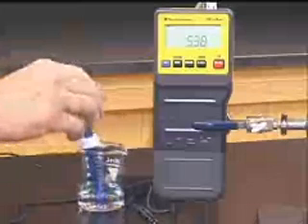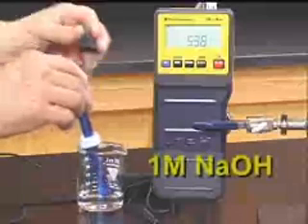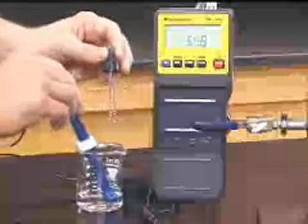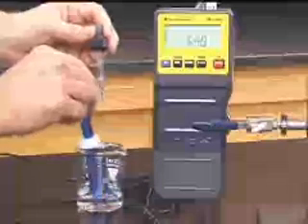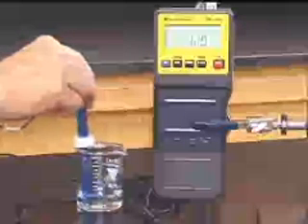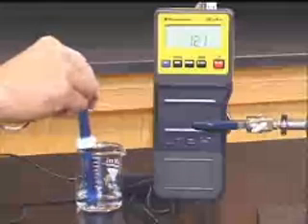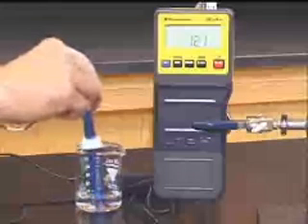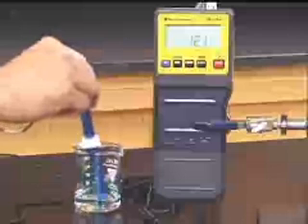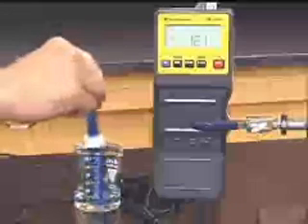What we're going to do is add a drop of one molar NaOH to the solution. Notice that the pH rises rapidly to a pH of greater than 12. Pure water, again, is not a very good buffer. If we add a strong base, the pH rises rapidly.